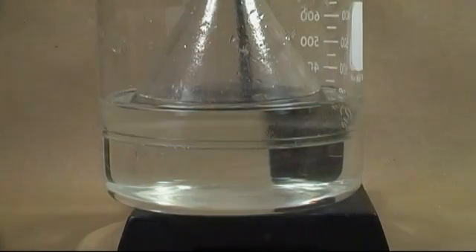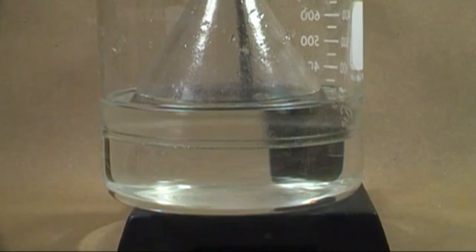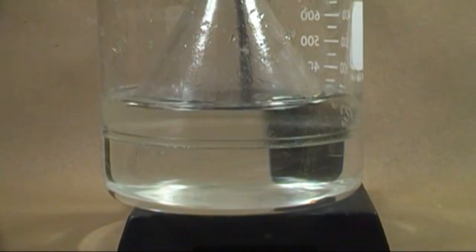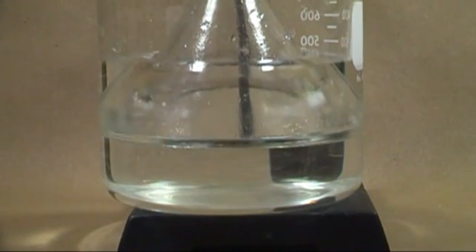Let's see how this works. As pressure rises, the gas will displace the small amount of water in the funnel, pushing the water up the sides of the beaker.